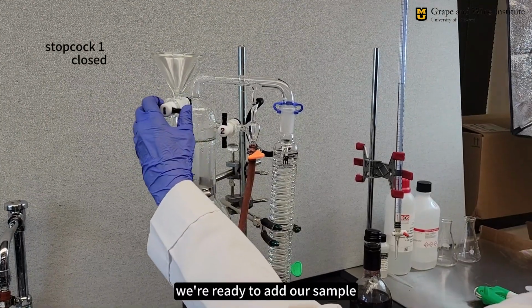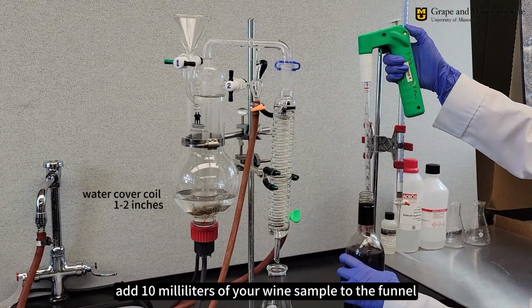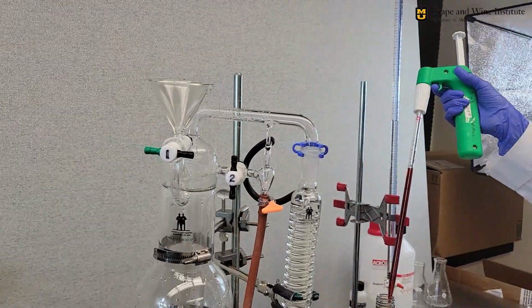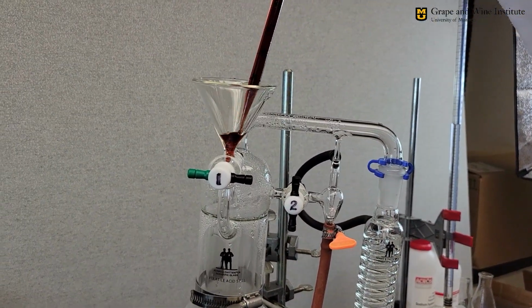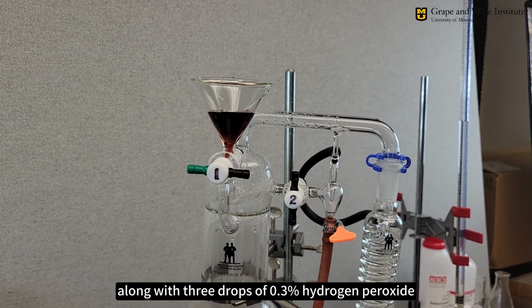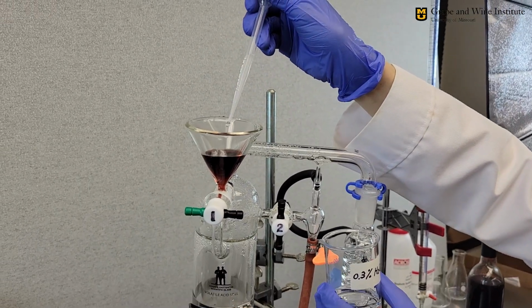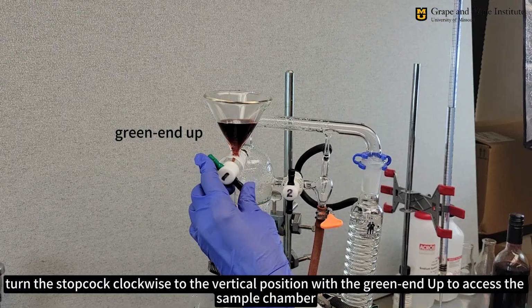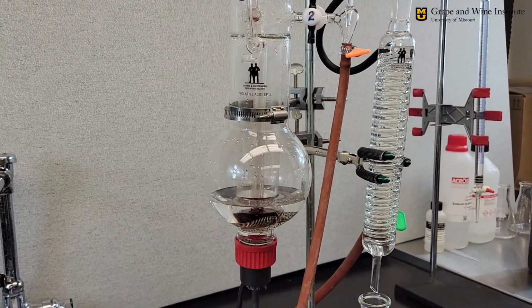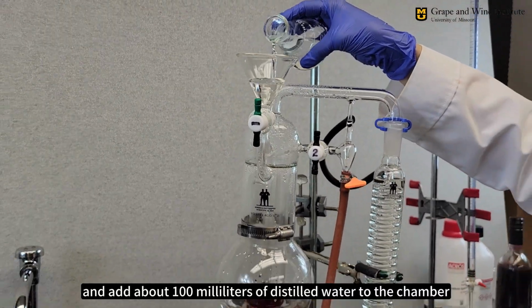Next, we're ready to add our sample. With the stopcock in the closed position, add 10 milliliters of your wine sample to the funnel, along with 3 drops of 0.3% hydrogen peroxide. Then turn the stopcock clockwise to the vertical position with the green end up to access the sample chamber, and add about 100 milliliters of distilled water to the chamber.